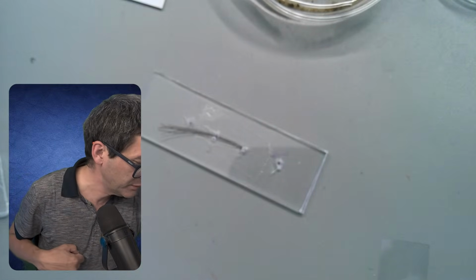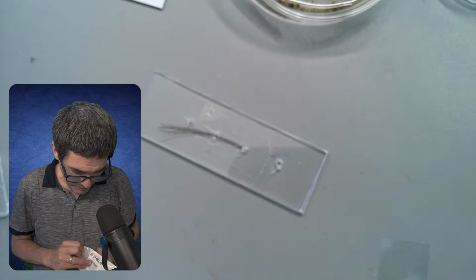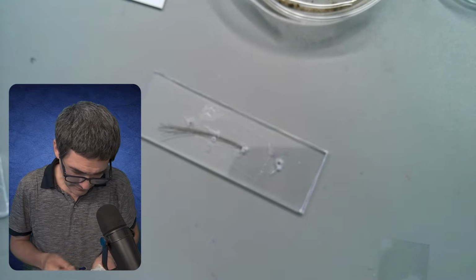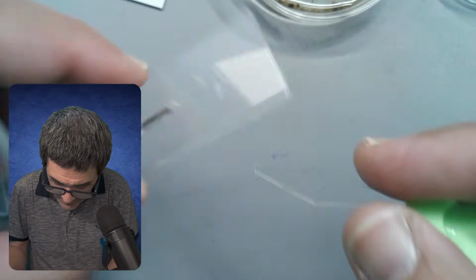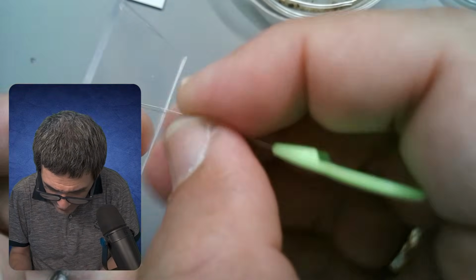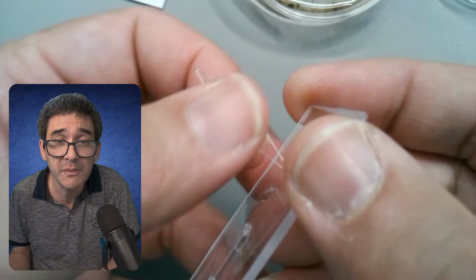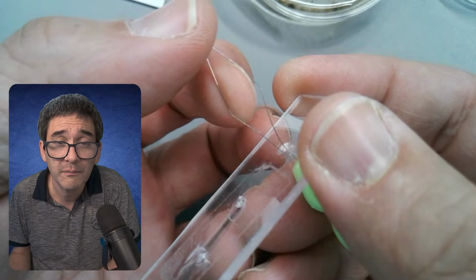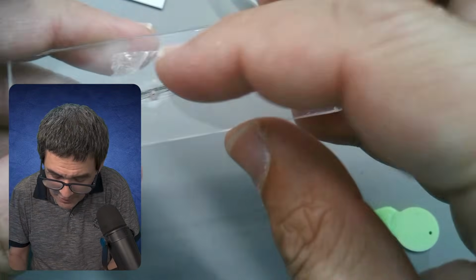Where did I put it? Here it is. Oh, they sent me a whole bag. I don't know if you know these things, right? It's for threading needles. So what I've done is I pushed it through one of those holes here, like this, and then put some hair in here. Then I pulled it through to get the hair in.